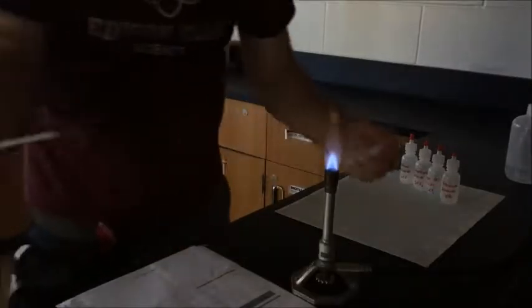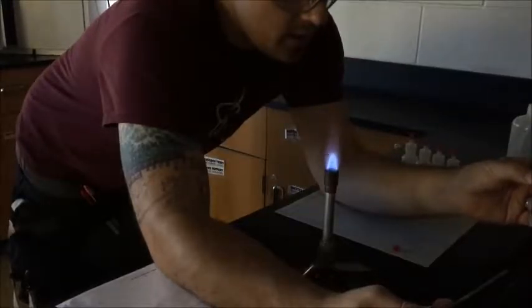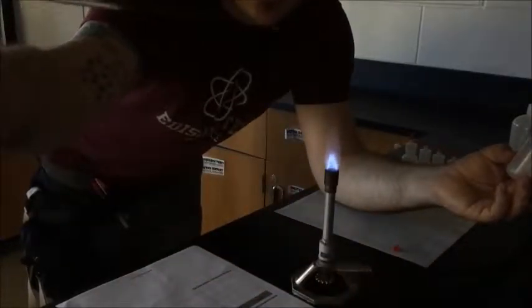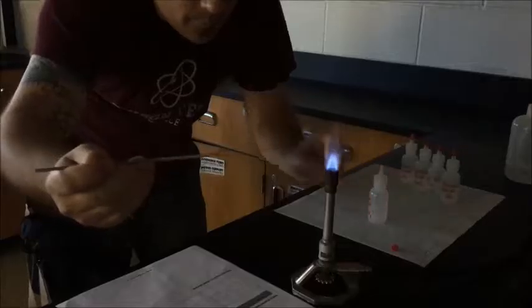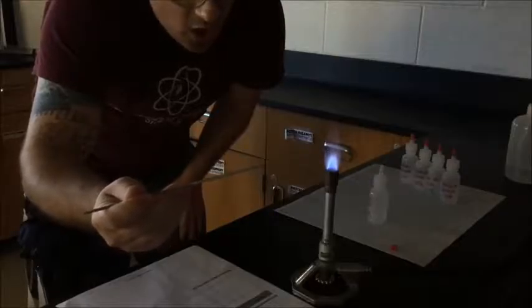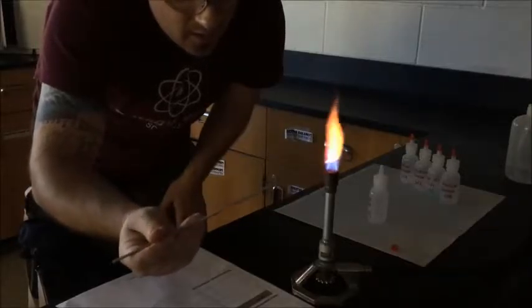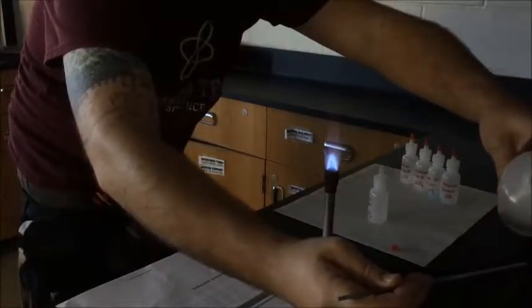Now, to test your unknowns and your knowns, you need to remove the drop bottle cap. And you've got to get a single drop of the liquid into the loop. So hold it over the sink and gently drip. Ah, there we go. A drop of the liquid onto it. I'm not sure you can see that very well, but I'm holding a bead of liquid in there. Now, I'm going to put it into the flame. I want to get it in there so that I can observe the colors it's going to burn. You saw the orange of the loop, but now this one's got a subtle color in there as well. See that for a second there? Gone quick. It disappeared very quick and easy. Very, very quick. So you may use a second or third drop. Rinse off in between.